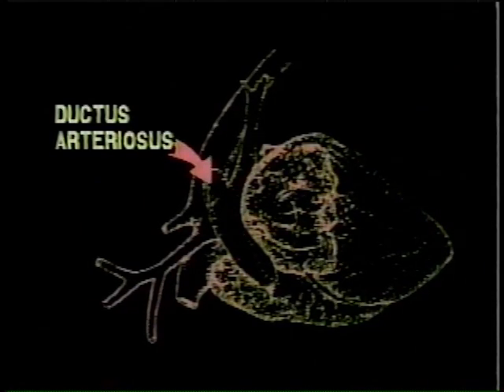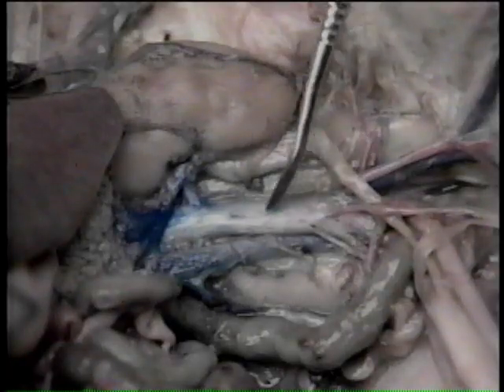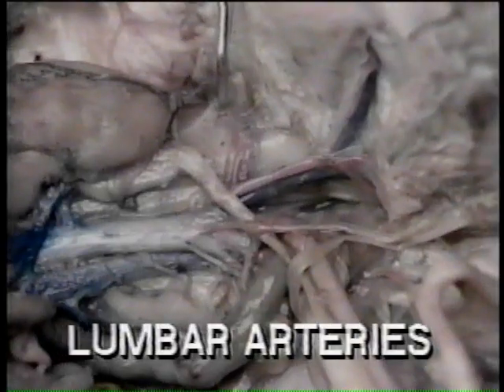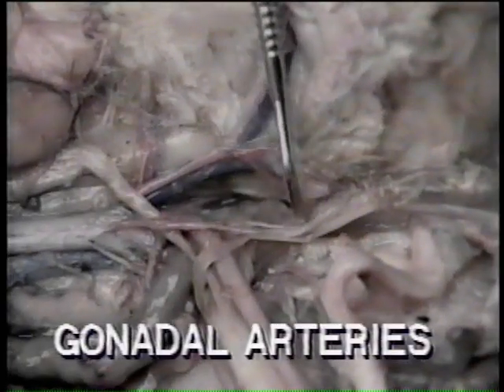Existing only in the fetal pig is a short connection between the pulmonary artery and the aorta called the ductus arteriosus. Because the fetal lungs are not functional, blood from the right ventricle is shunted into the aorta rather than flowing into the lungs. The aorta runs through the thoracic and abdominal cavities near the spinal column and branches out to renal arteries supplying the kidneys, lumbar arteries supplying the muscle of the dorsal abdominal wall, and the gonadal arteries, which are the ovarian in females and the spermatic in males.